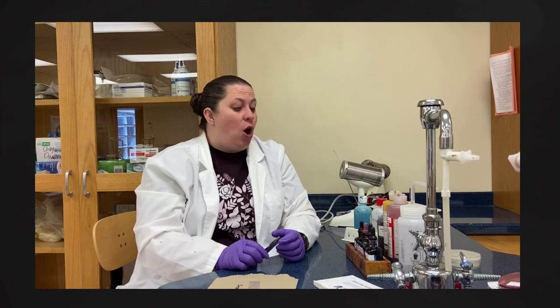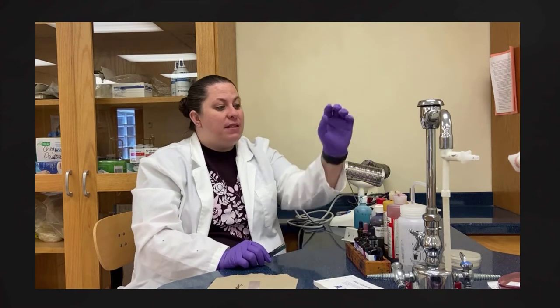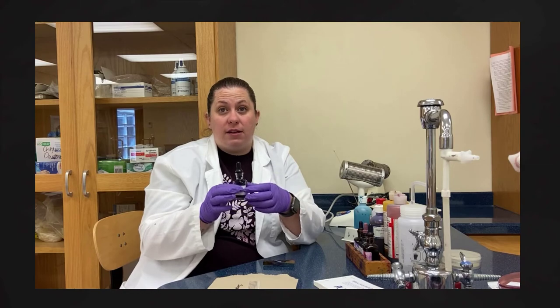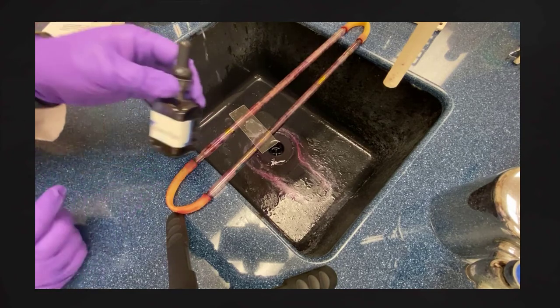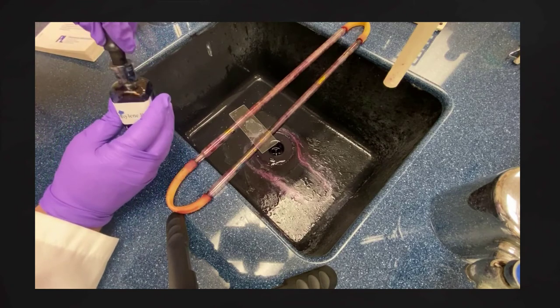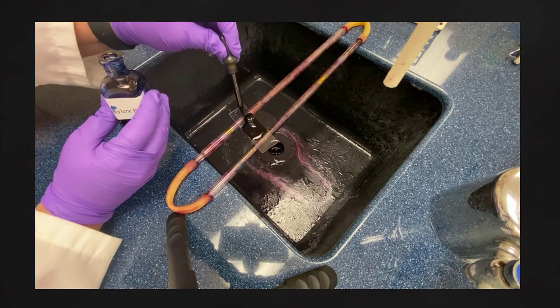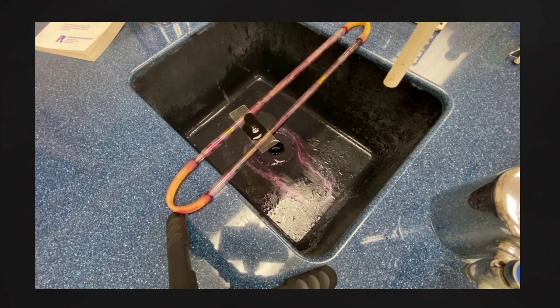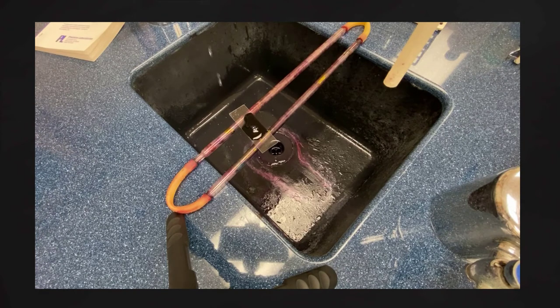The first stain we're going to look at is a simple stain, using one type of dye. We could use crystal violet, but in this case I'm going to use methylene blue, which will make the cells appear blue under the scope. I've placed my slide on the staining rack. We're going to take the methylene blue and flood the slide, making sure the whole smear is covered with the stain. We then allow this to sit for approximately one minute — about 60 seconds — allowing the stain to be taken in by the bacteria.